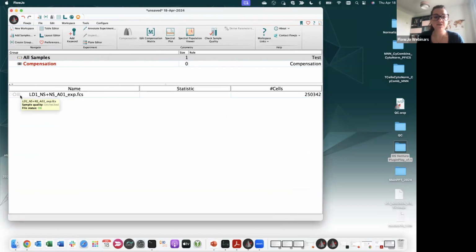And as you can see, this file has a gray matrix, which doesn't mean that it's not compensated, but it means that it's using the compensation from the instrument, the so-called acquisition defined. So if you perform unmixing on the instrument, your data are still considered, let's say, raw in this case, so you can still use FlowAI and FlowClean.